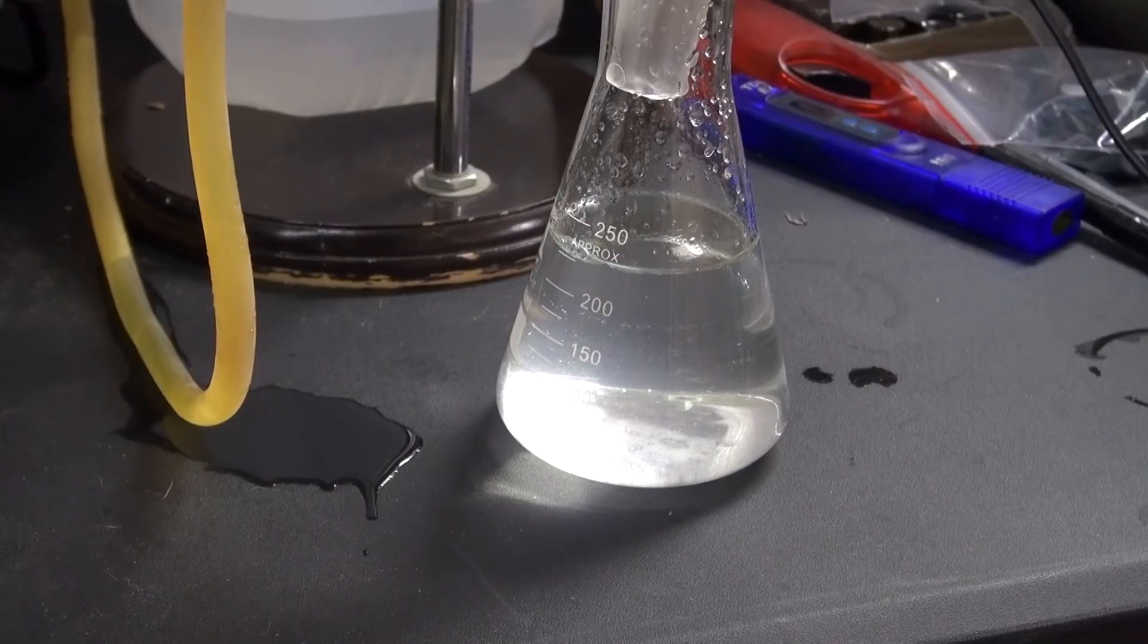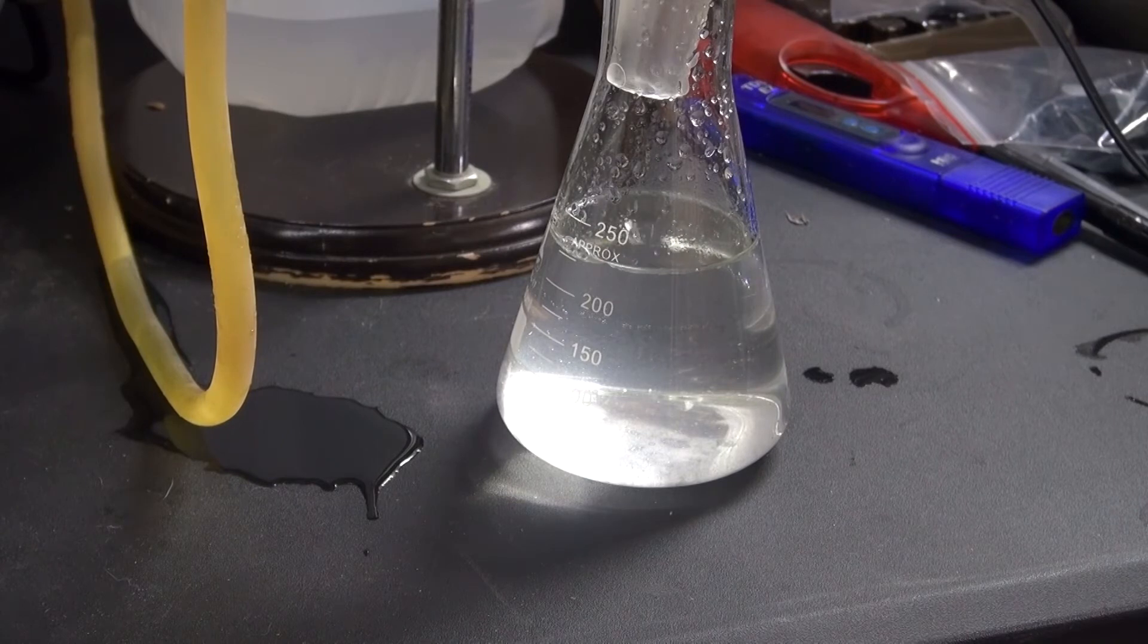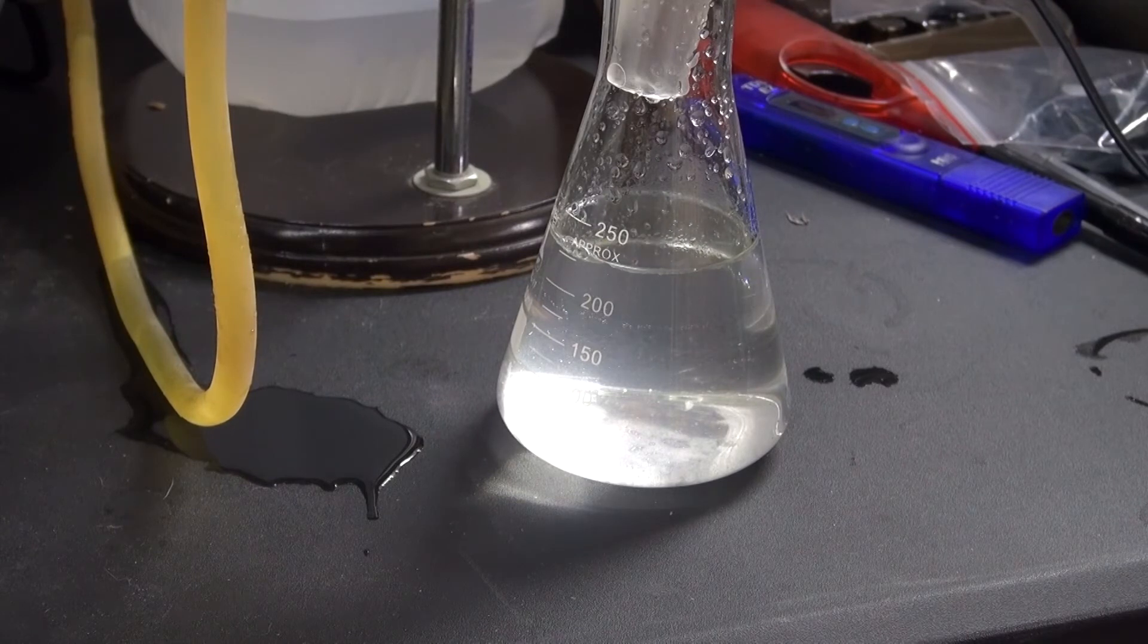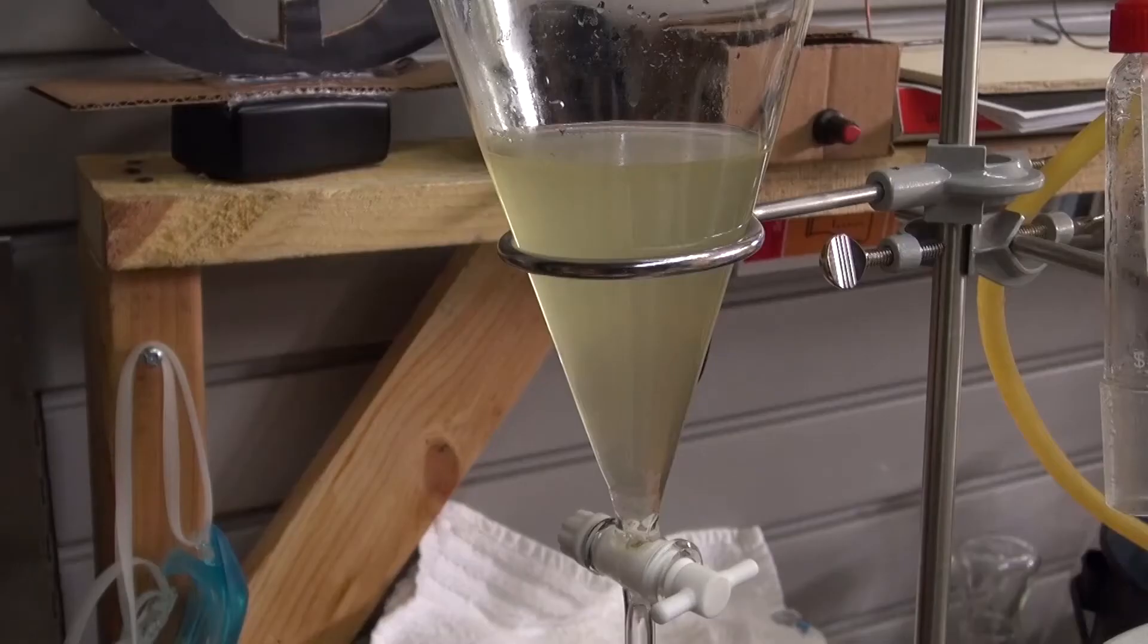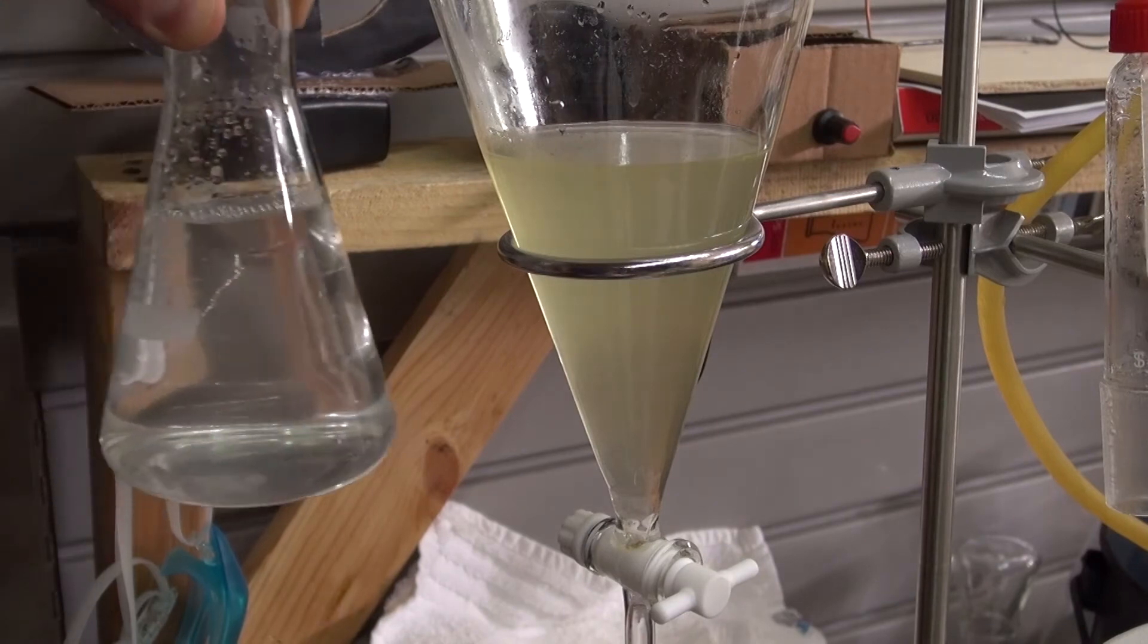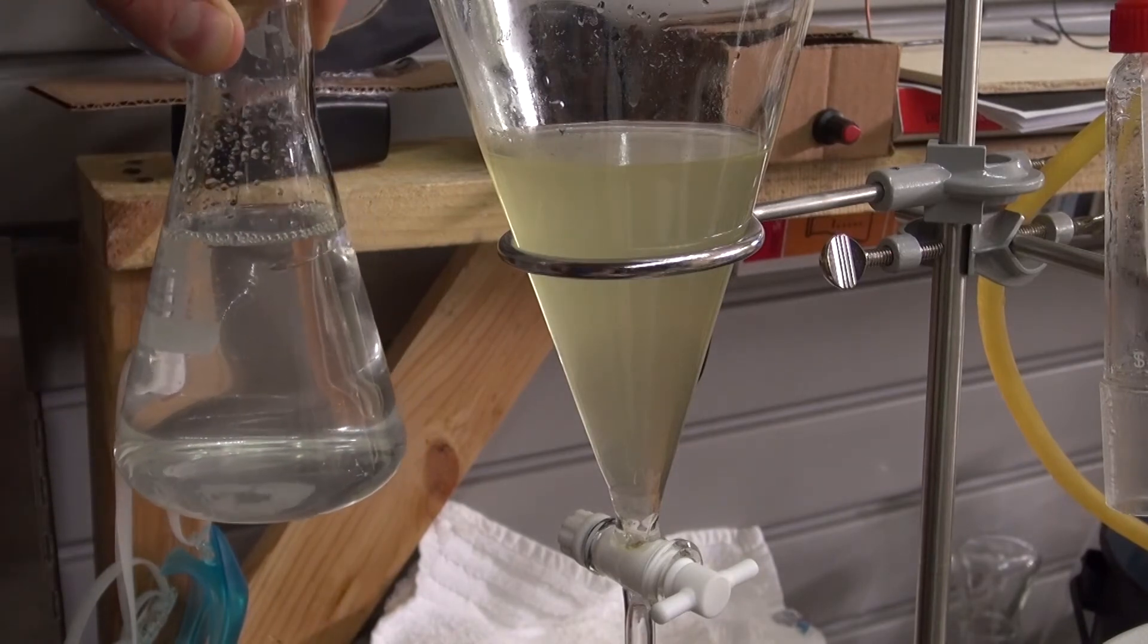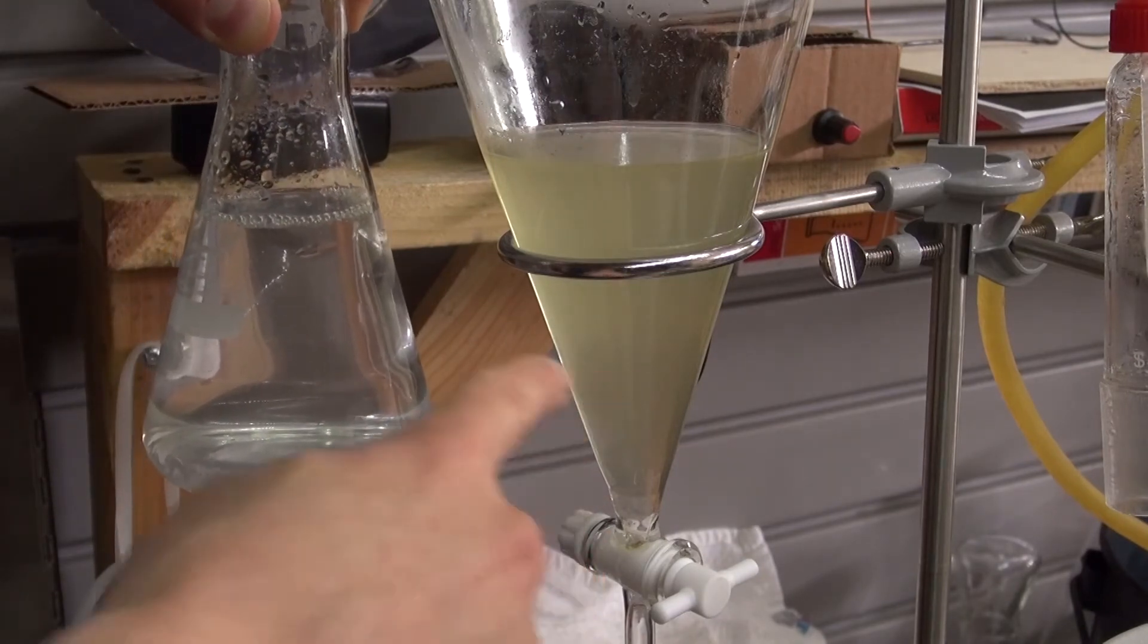Another hour and a half later, and this is what my final result looks like. As you can see it's clear, this is exactly what it's supposed to look like. So clearly my first batch is completely contaminated compared to my second batch. A huge contrast between the two.